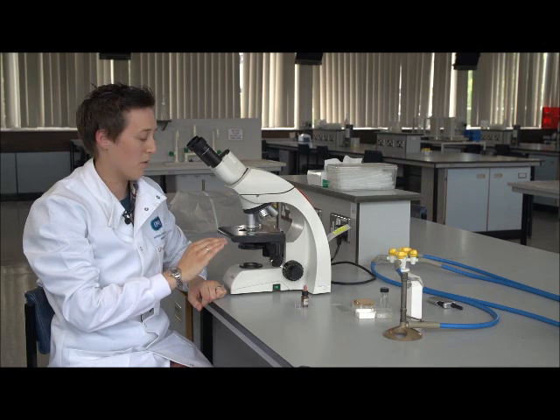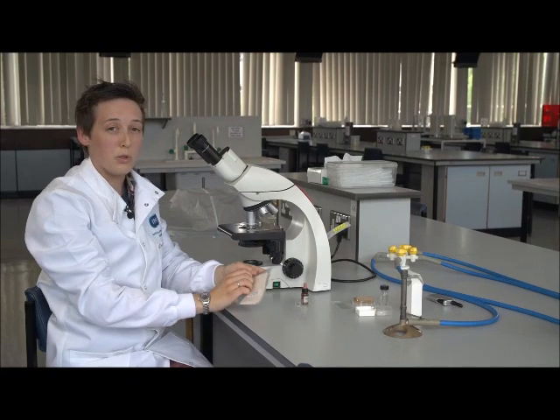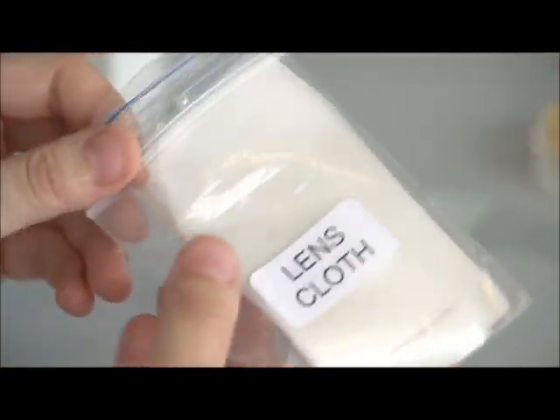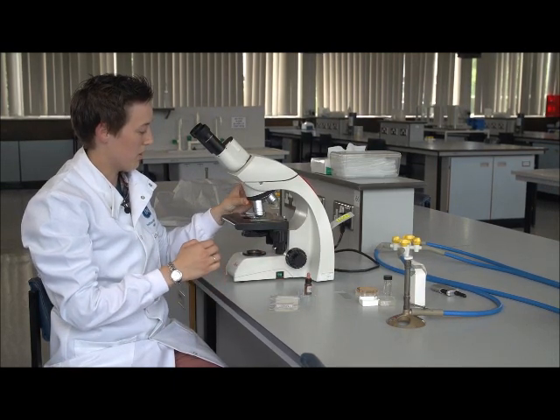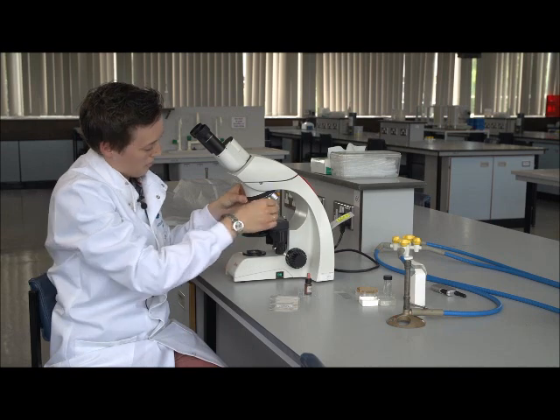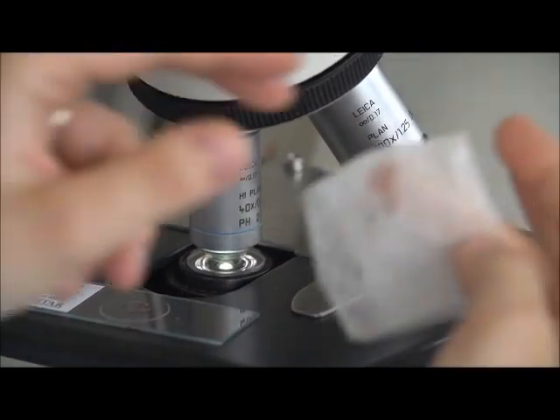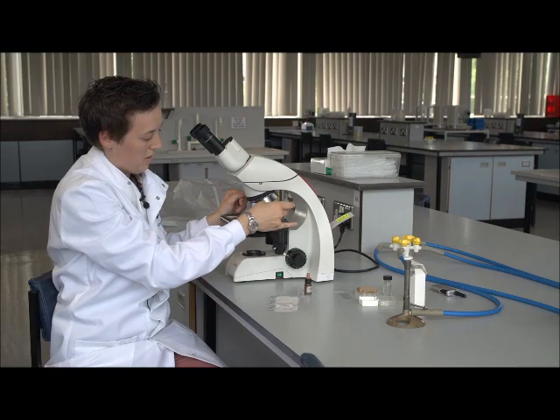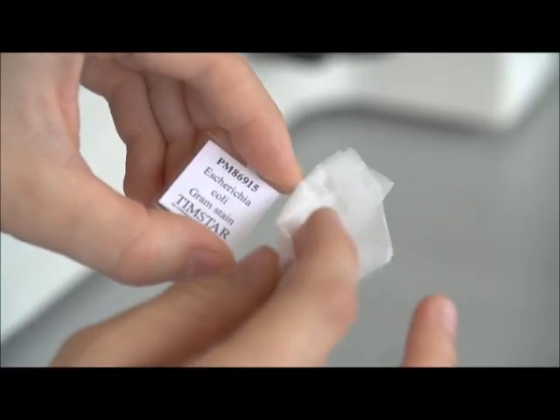So the really important part now that we're finished using an oil objective is to clean the oil off so that we don't accidentally get any oil on any of the dry objectives. Now we do this not using the normal tissue that's in the lab, but using lens cloth. And this is special fine tissue that's designed for cleaning objectives without damaging them. So we again can go to the halfway position. We can take our slide out, and now we can swing the 40 back in, allowing us to get to the 100 times. We can then wipe the oil from the 100 times lens, so that is now clean. And it's also a good idea to remove it from the specimen that you've been looking at, to keep this clean so that other people can use it.